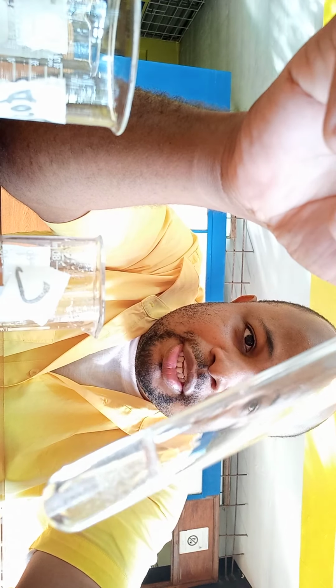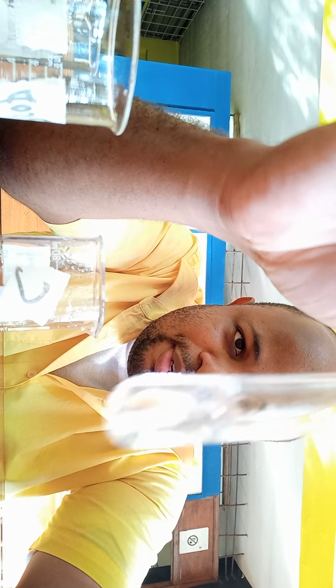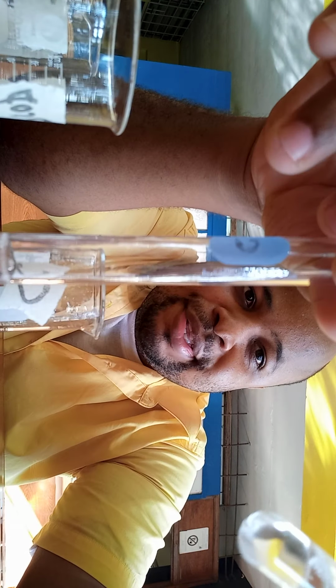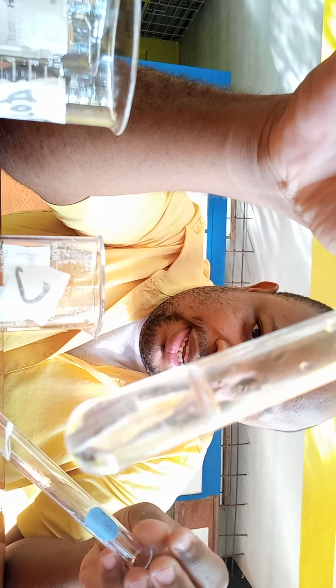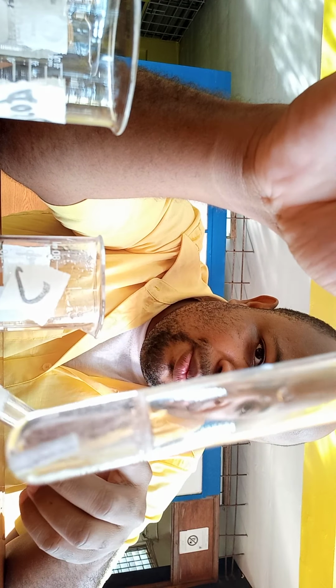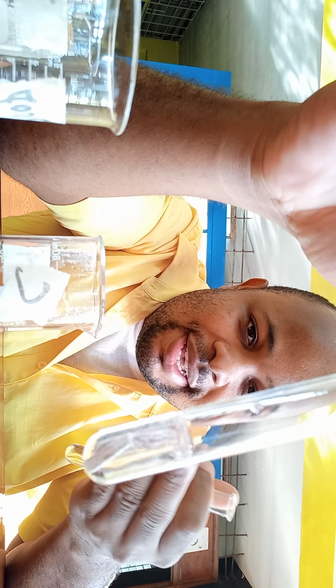Now if this is test tube A, we expect C to have the carboxylic acid, which is a weak acid. So that is why it is reacting slowly. Alright, this would be the ethanoic acid, which is a weak acid. The reaction with the magnesium from this one, I'm assuming it would be with the sulfuric acid present. So once that is used up, the reaction would cease. But this container would have been ethanoic acid. Hence you're seeing it reacting with the magnesium metal slowly because it's a weak acid.